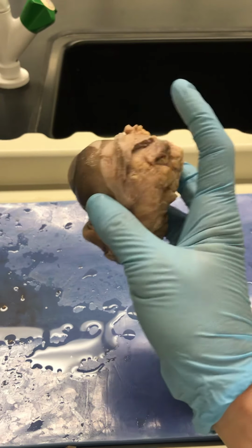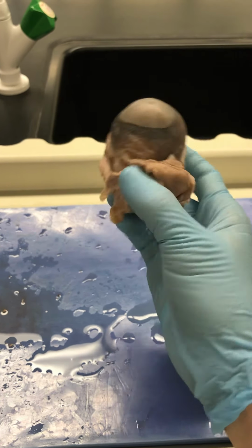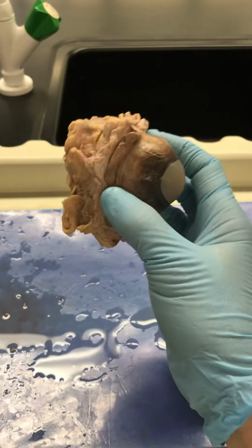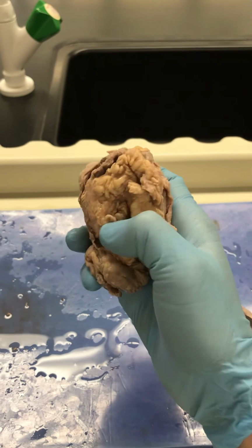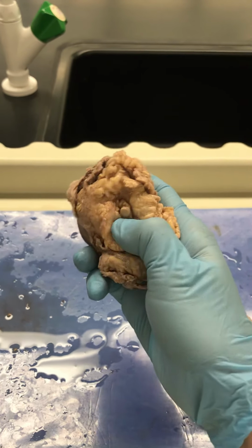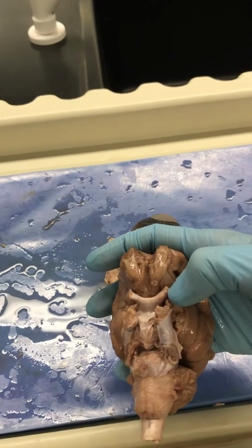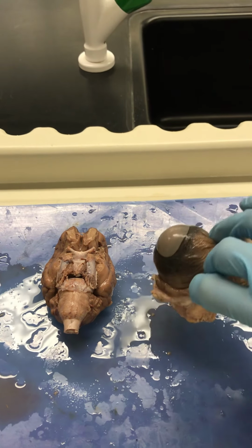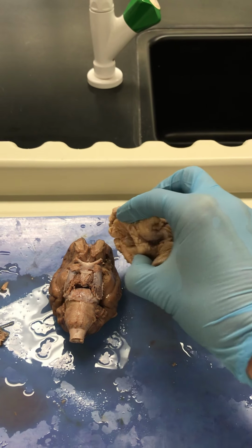So notice all the muscles that are around the eye here. The cows have 4 muscles that move their eyes up and down, left and right. We have 6, so we can roll our eyes. And then we have our optic nerve back here. In the sheep, we have our optic nerves here, so that would connect. So this is a cow eye and a sheep brain, and there's that optic nerve, okay?